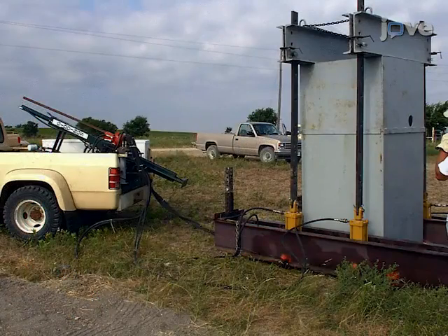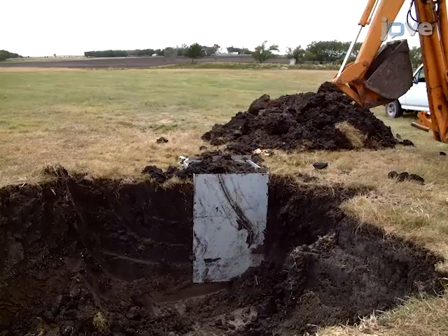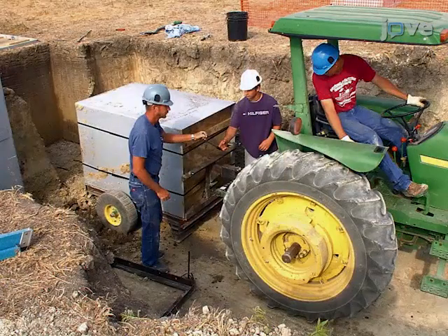Press the box down into the desired soil using a hydraulic press secured to the soil by 3 meter-deep helical anchors. After pressing the box into the soil, excavate the surrounding soil with a backhoe, cut the monolith base free from the soil below, and remove the monolith.